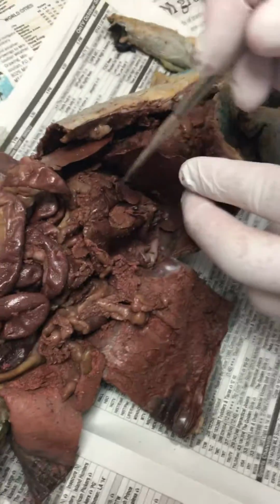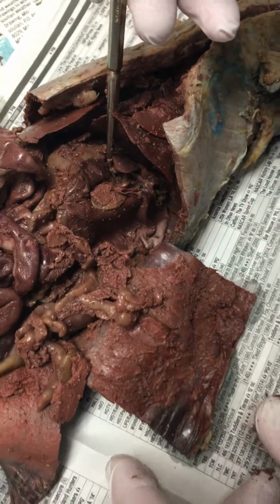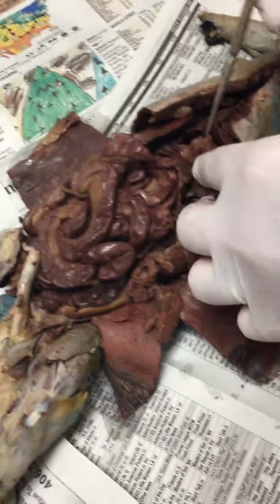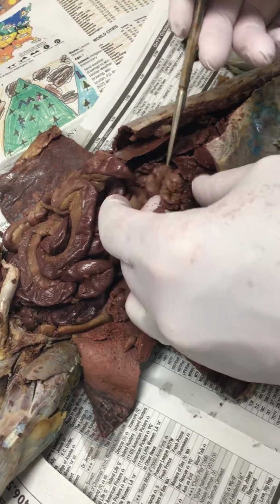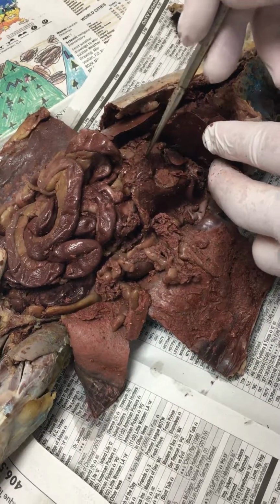Situated right by the caudate lobe, that's the stomach. That's the part your greater omentum should have been attached to, but somebody pulled it off. Somebody ripped your greater omentum off. Here's a little bit of it here. It's that big fatty thing that covered everything. So that's the stomach right here.